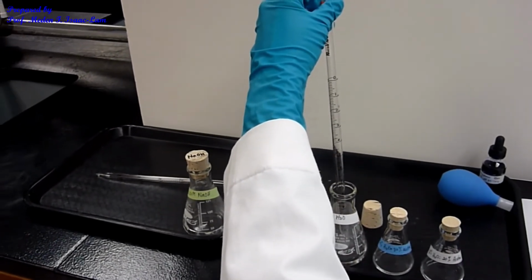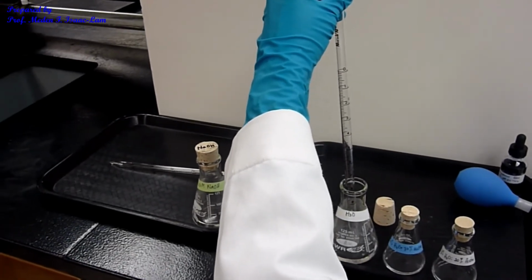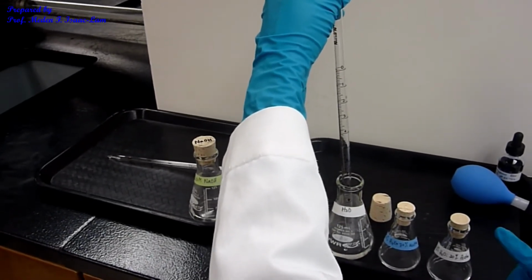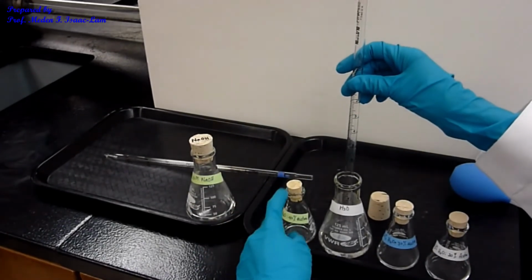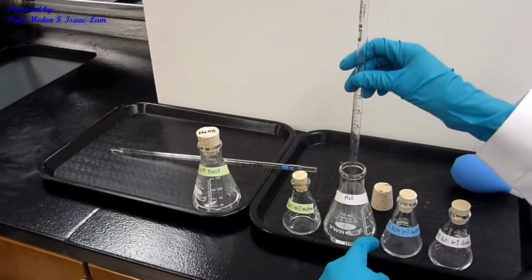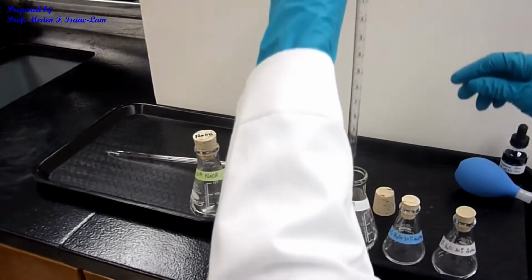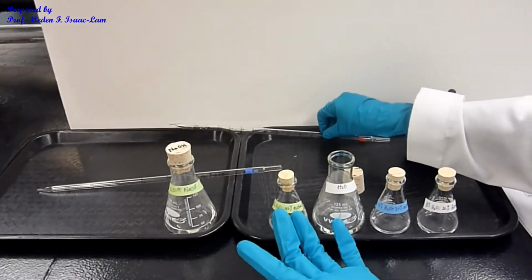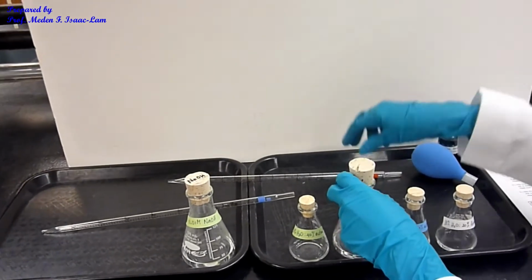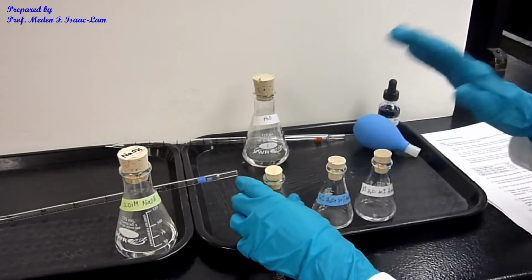If you're doing this in the lab, you are going to do it 2 or 3 runs each. So I'm doing just one. Typically you're going to have another flask with 60%, 70%, and 80%, because you should have 2 runs. So I'm going to put it here just in case I need to redo the water. So this is for the water. These are my samples, just my water.